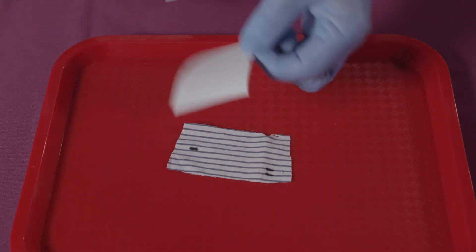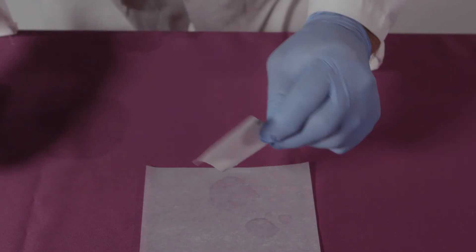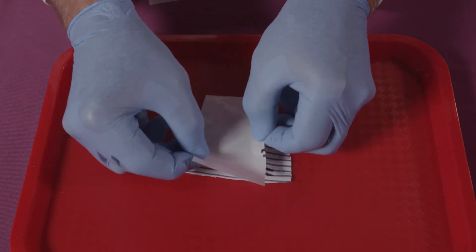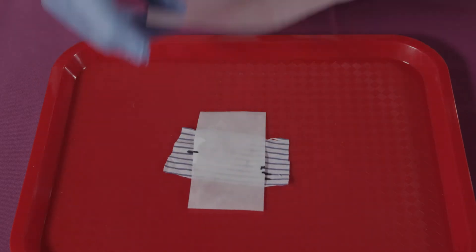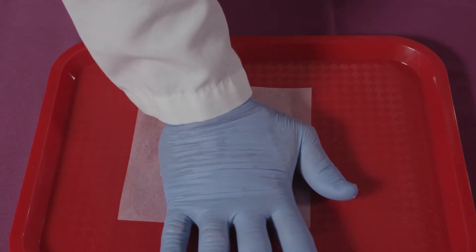The paper is moistened with just enough water to saturate the paper. Paper is then placed over the article aligning the hash marks. Weight paper is placed over the amylase paper and using gloved hands pressure is applied for 10 to 15 seconds.